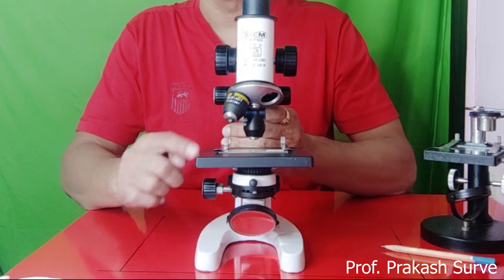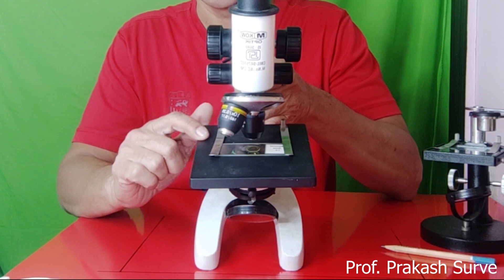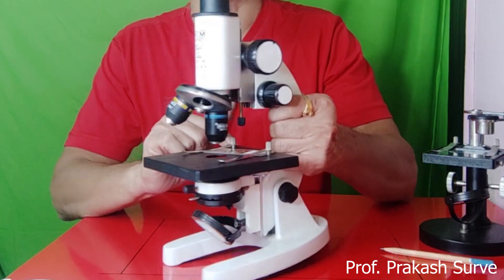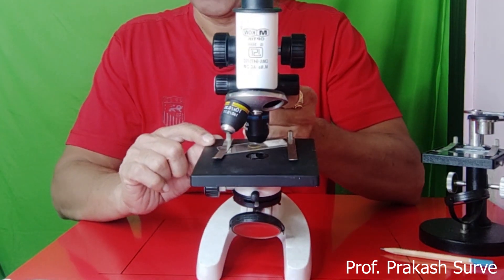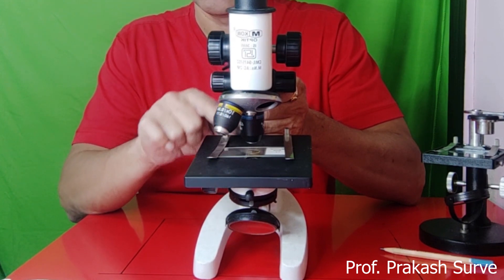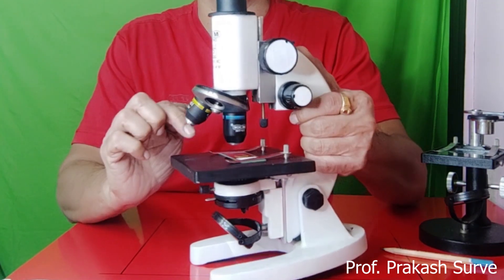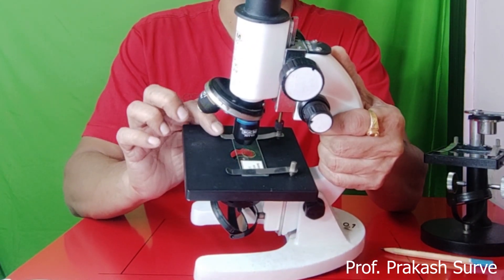Next is the stage. The stage is a metallic platform with a central hole, fitted to the lower part of the arm. The microscopic slide is held on the stage by two clips, which keep the slide in the proper position.